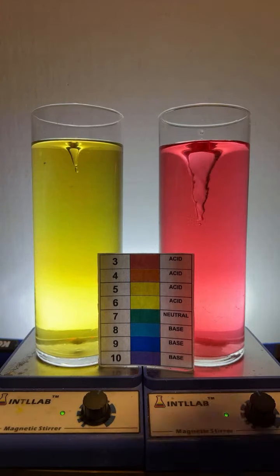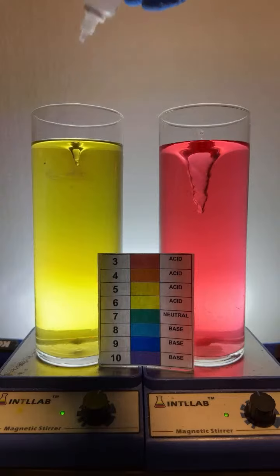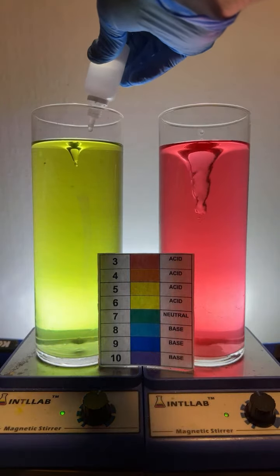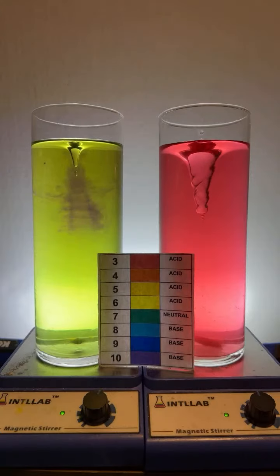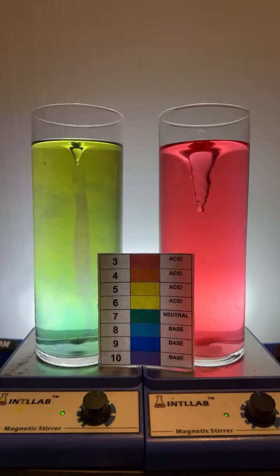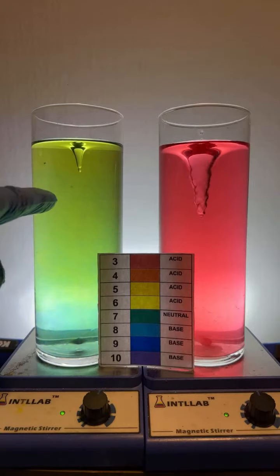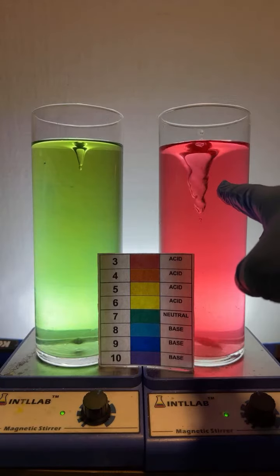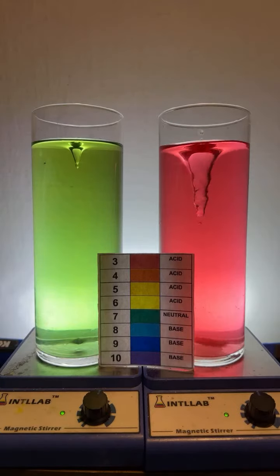I have kind of been into chemistry, I would say, since the late 1980s. These are not buffer solutions because the pH is changing quite rapidly upon addition of acid or base. This is not acetic acid. Green on 1, and we want orange on 2. Yeah, I'm going to be live for at least an hour here, Sarah, is the plan.